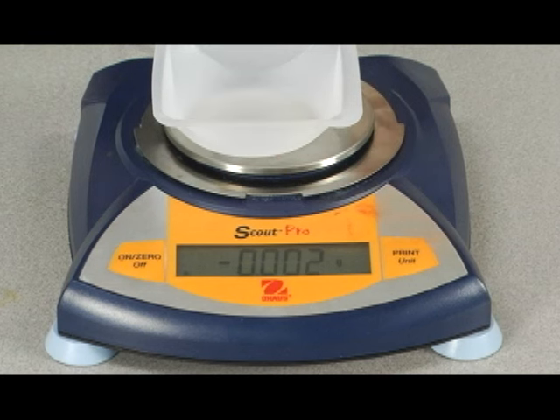Fluctuations in the third decimal place are typical — just us moving around in the room is going to cause that to fluctuate. So, we've accurately measured out 0.804 grams of sodium acetate. This is measured to the third decimal place. That's important to remember.